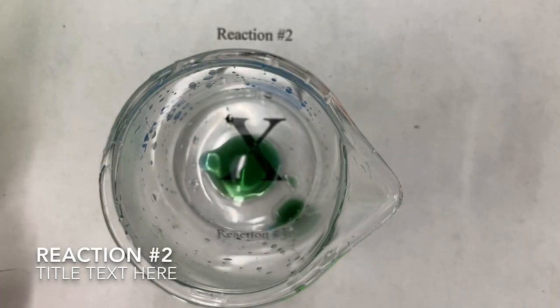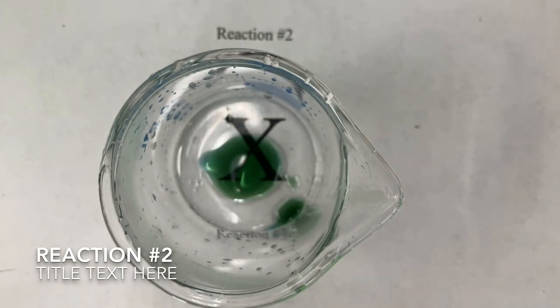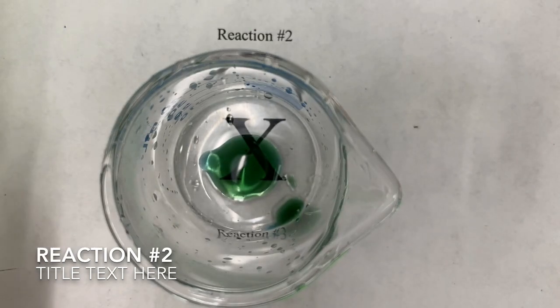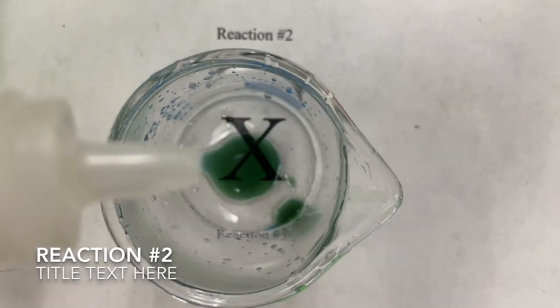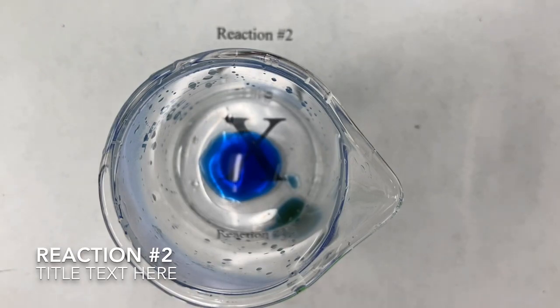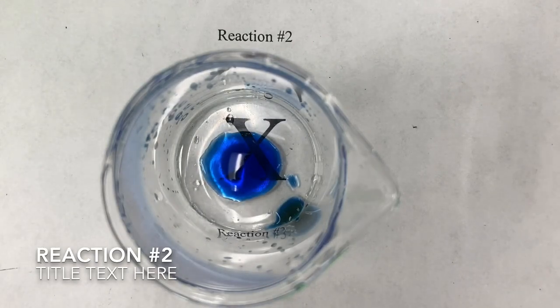So again, before I add this, take a moment to predict what do you think will happen when I add ammonia. Feel free to pause the video to write your answer. And here, again, I'm going to add some ammonia to this BTB. This is reaction number 2. Let's see what happens. Okay, we see a very clear change, and it becomes blue. And that's reaction number 2. Did it match your prediction?